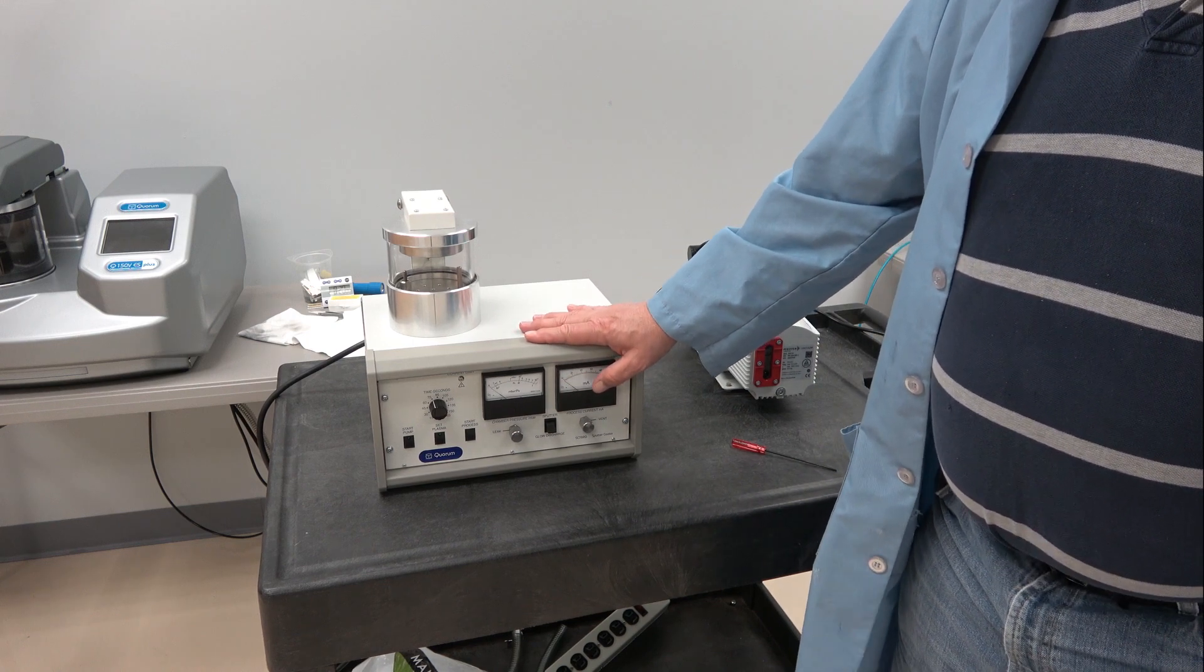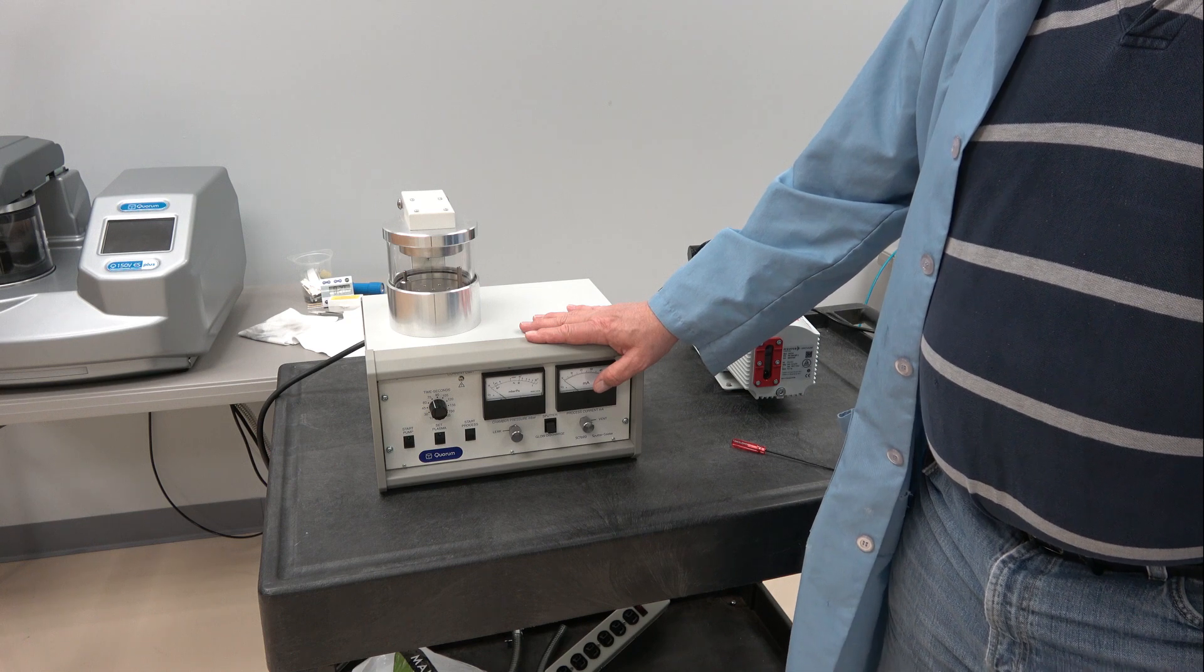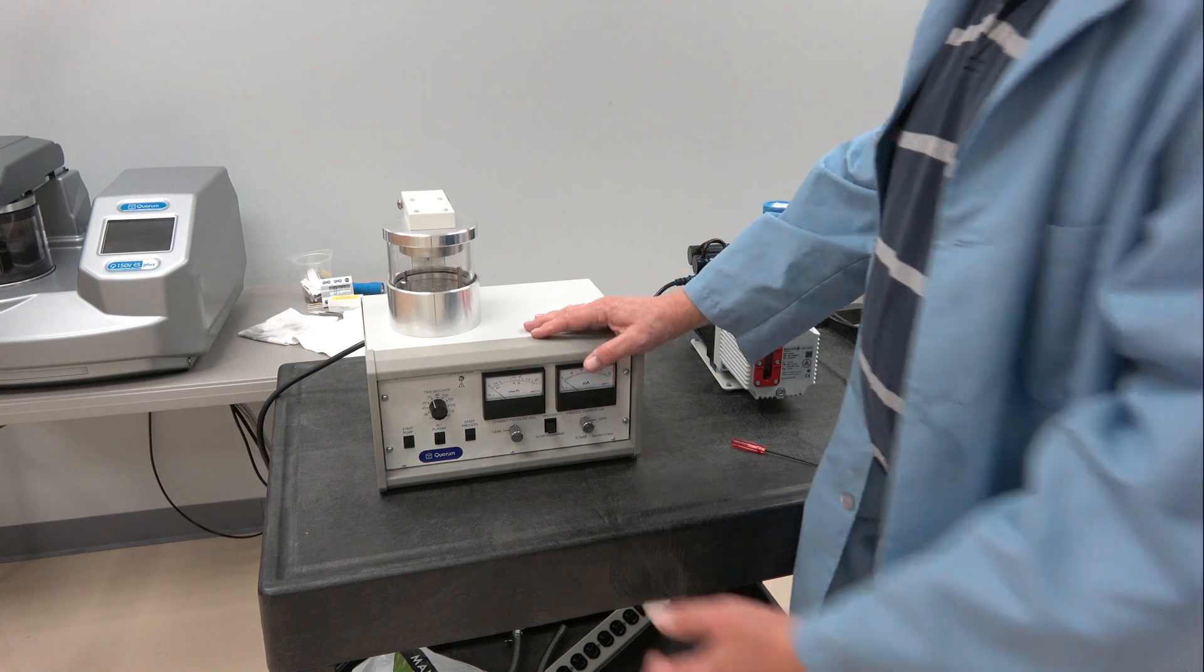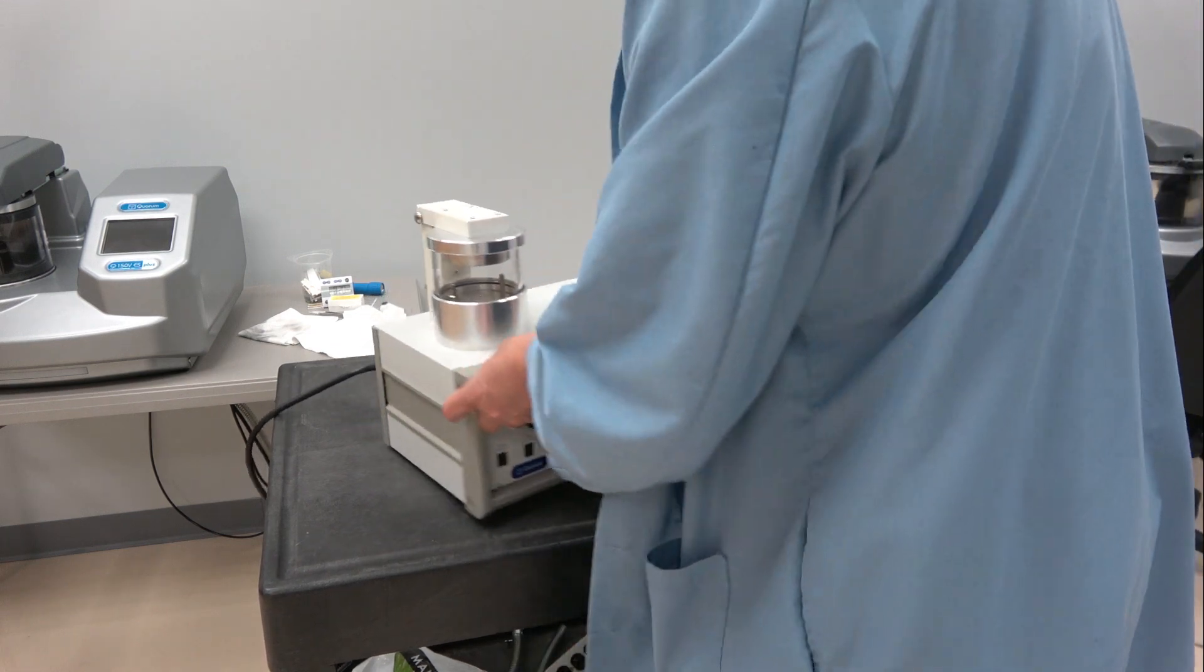It's completely manually operated and I'll show you how this all works as we go along. First, let's have a look at the back of the unit.